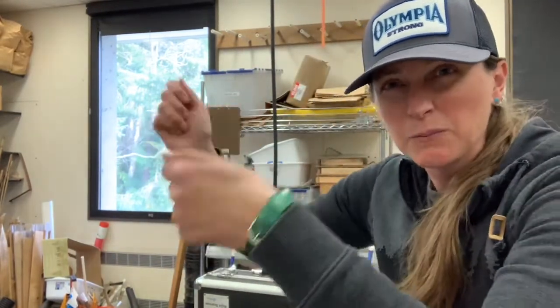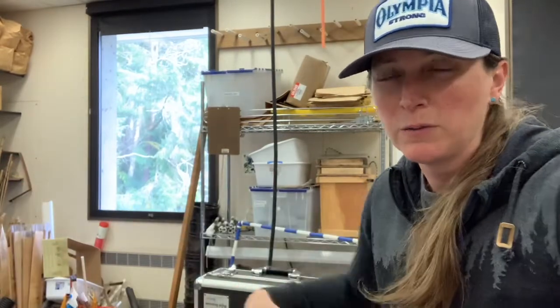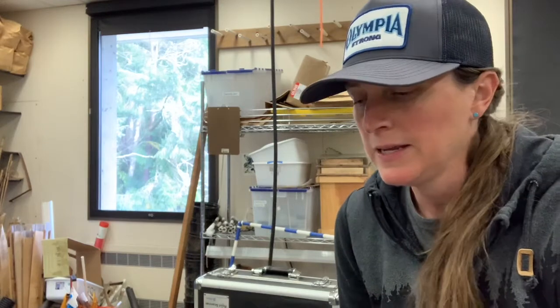If you're interested in catching flying insects, you might use just a big swish net, a big net that has a nice soft cotton loop on it so you wouldn't hurt the insects. You could also just go around beating branches with a piece of white fabric underneath and you can catch all kinds of really cool insects just by beating on branches.